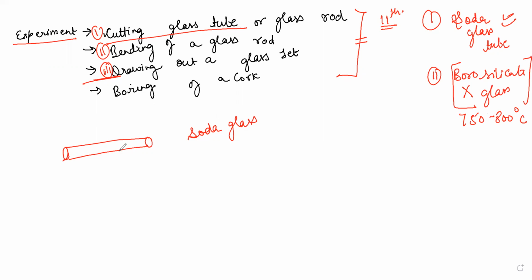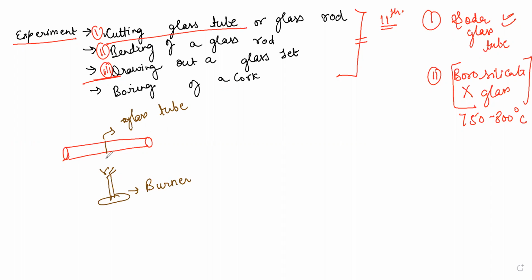So now let's get started with the first experiment, which is about the cutting of the glass tube. The first requirement here is that you should have a burner, and this is the glass tube which we are using. Take a marker and mark a line from where you need to cut this glass tube. After marking the line, while heating the glass tube, make sure you rotate it also. Don't heat at a constant place, because we don't require a lot of heating here. We just need to give it an appropriate temperature so that it gets softened and we can cut it with the help of our hand.